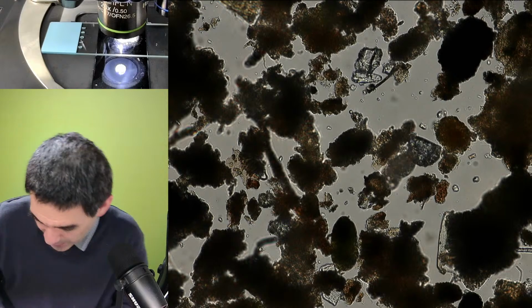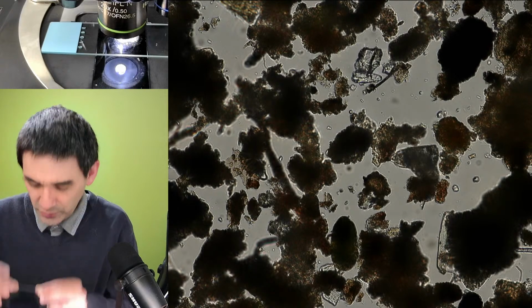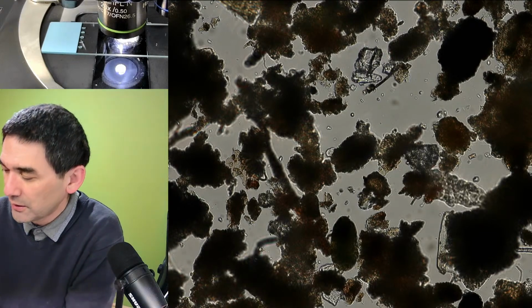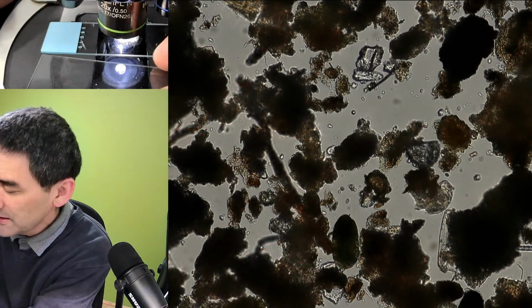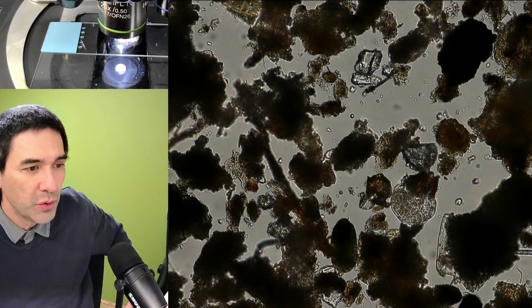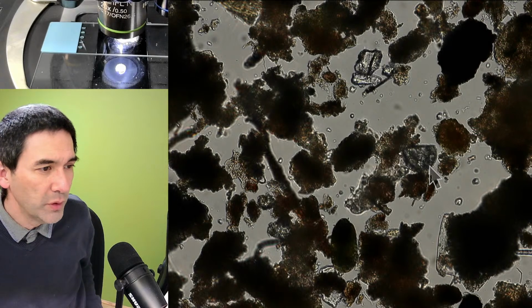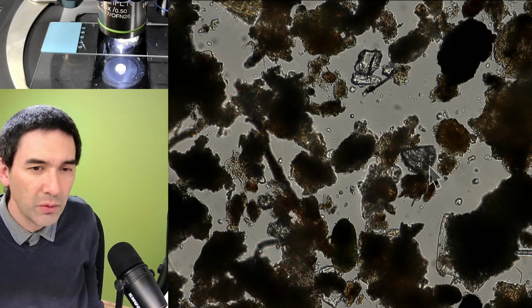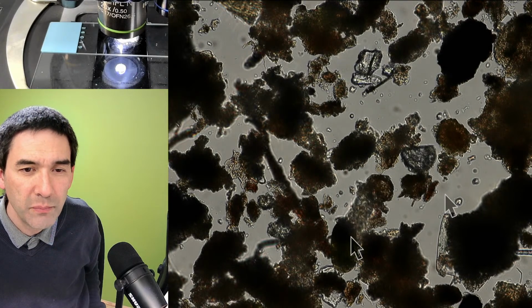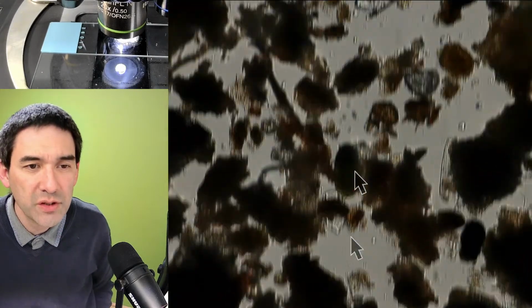And the question is how big are water bears? I have over here a micrometer slide, a calibration slide. I have to get the direction correct. Now I'm going to turn on the arrow again. Here's an arrow, and I'm going to turn on another arrow. So I've got two arrows. One end of the water bear is here, and the other end of the water bear is about here. It's just approximate.